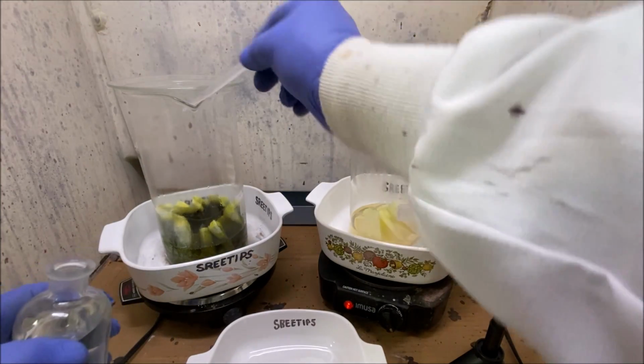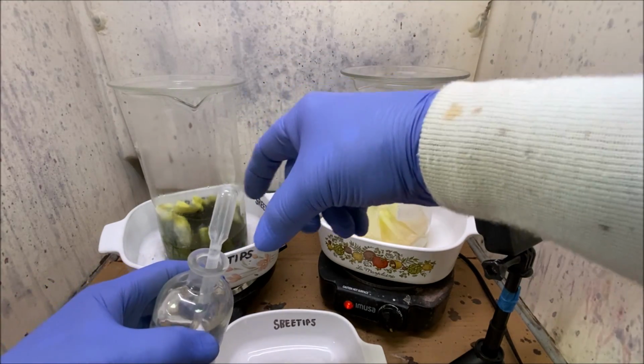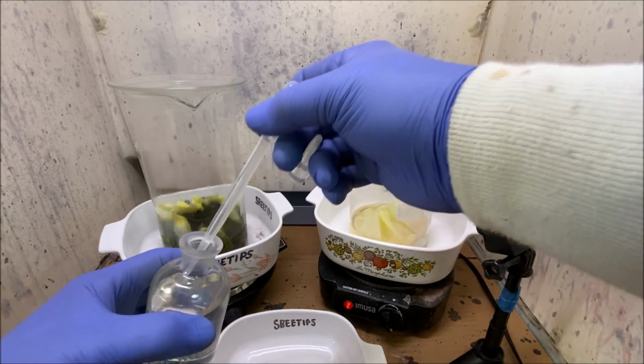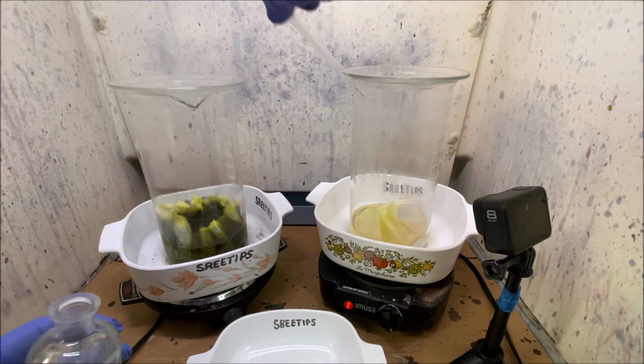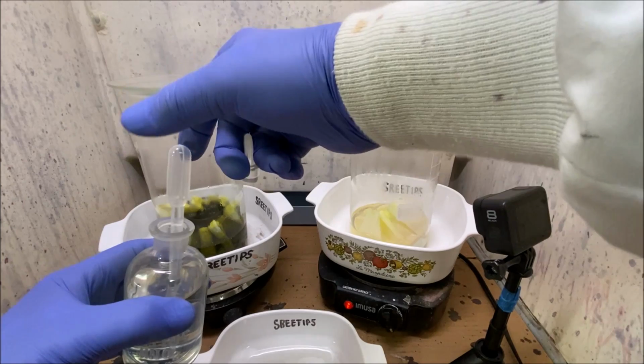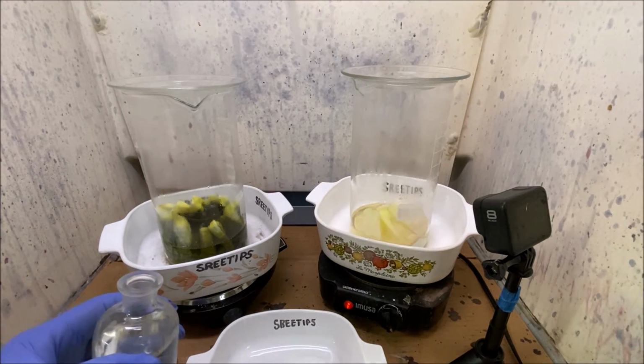We've got platinum group metals in here. They're very dangerous in solution, and this can't be done in your backyard. You've got to have a fume extractor to be able to do this. There's no way to safely do this without a fume hood.